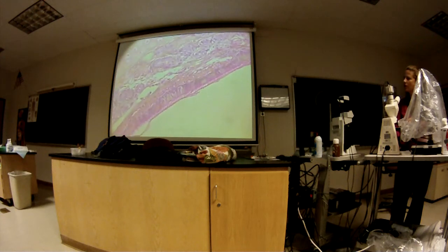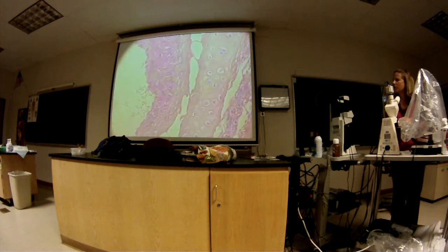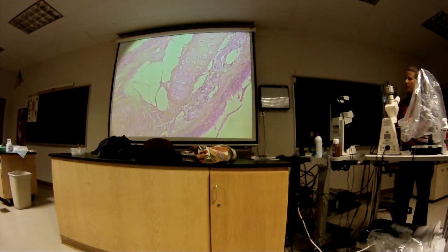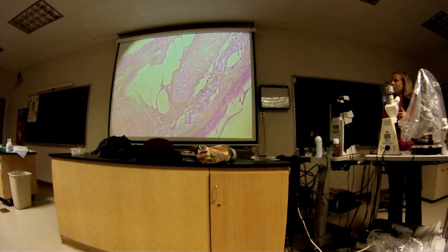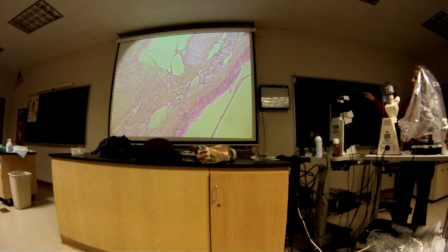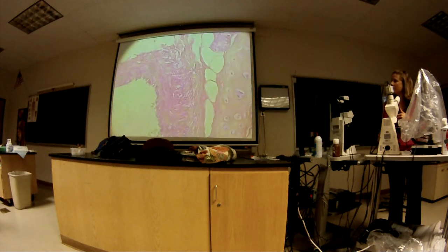Yeah, so this is a bronchus. It has the cartilage plates. See where it's not all the way around. The primary bronchi, which is the first division from the trachea, usually do have the C-shaped cartilage all the way around, but as it gets further from the trachea, the bronchi end up with the plates instead of the C-shaped cartilage. So that's another thing. See how it's separate? It's got these little sections. Smooth muscle is... It does have smooth muscle, yeah.